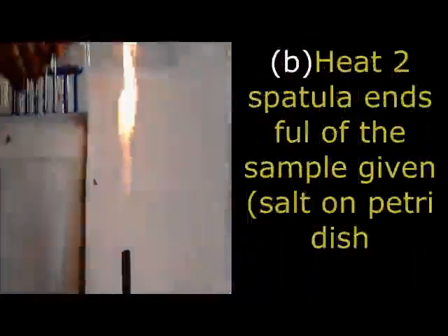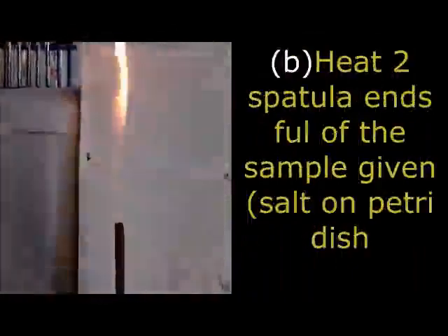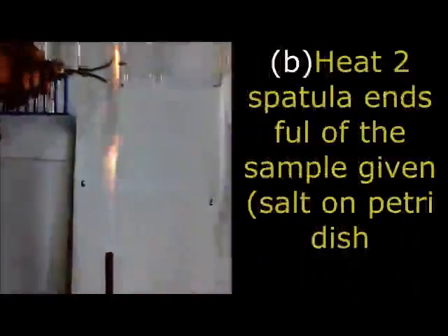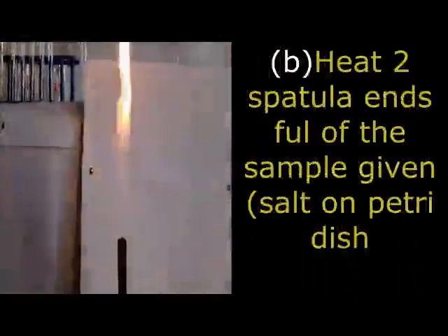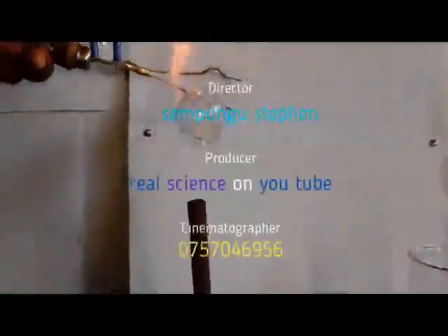So now when we are going to heat, members, don't forget this one: our boiling tube should be dry. How do you dry it? You make sure after washing it, you go to the fireplace or the flame, and then you try to dry it out. Then after drying it, you can see me there drying the test tube. So you have to dry the test tube or the boiling tube.